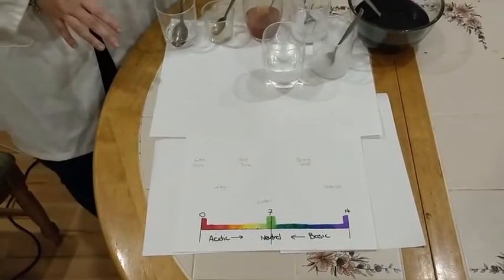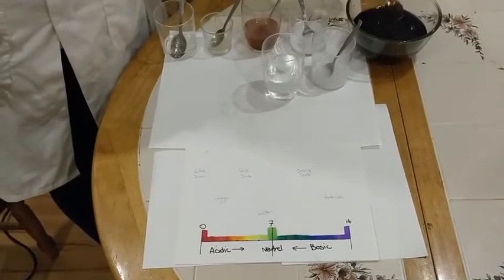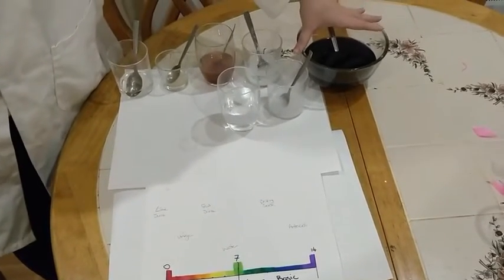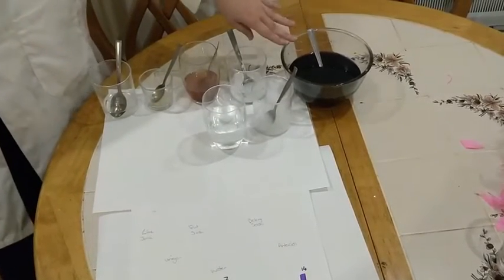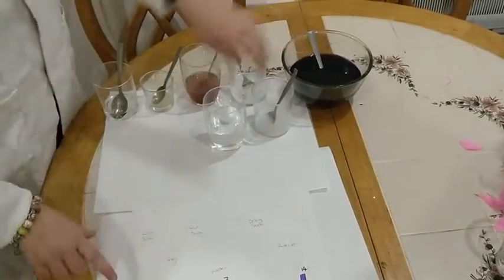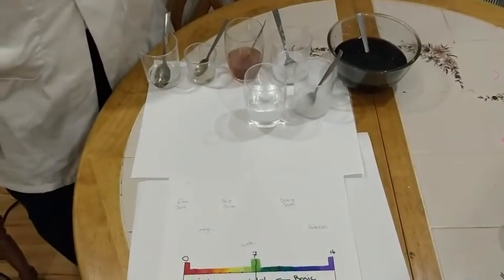So I have a range of chemicals here that I have prepared, and I also have a homemade version of indicator. As you can see, when I lift this up, this is purple. This is the juice of red cabbage that has been cut up into small pieces, boiled and left to cool. This will act as our universal indicator. We used universal indicator in the lab, but we will be using the red cabbage to show some of these colour changes with the 6 chemicals that I have assembled here.